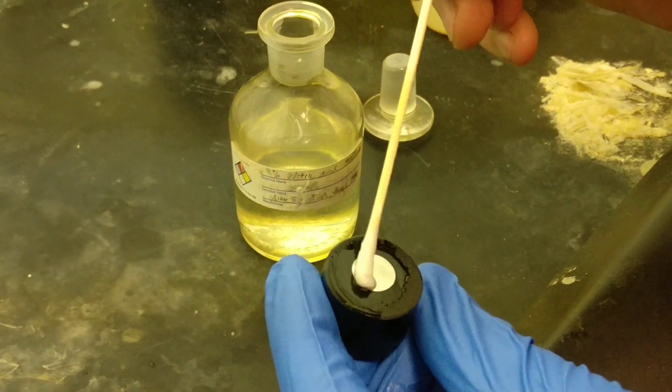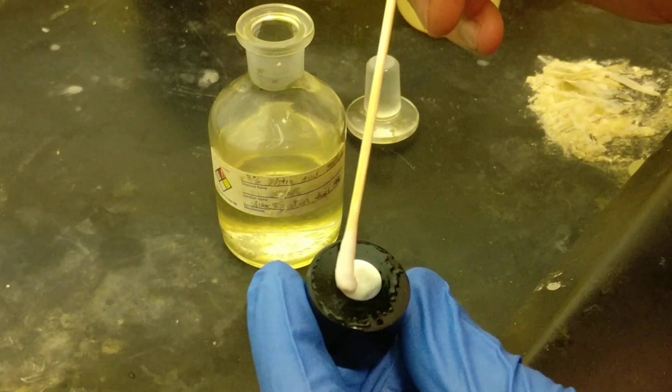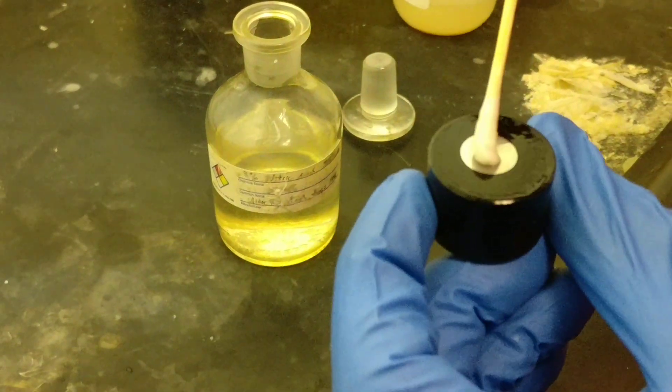So you want to saturate the sample with the liquid, and don't let it dry out, and keep swabbing in circles like this. We start to see the cloudy finish.